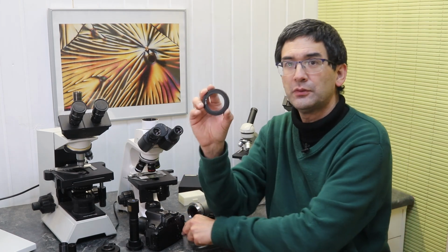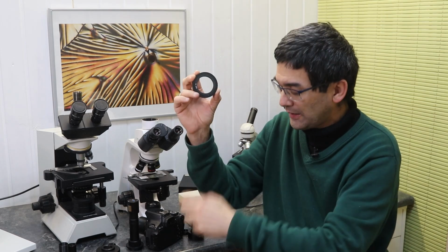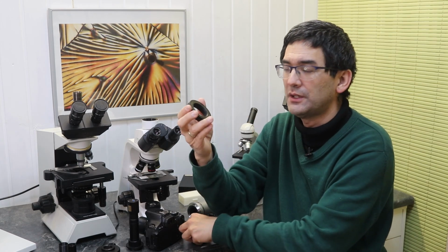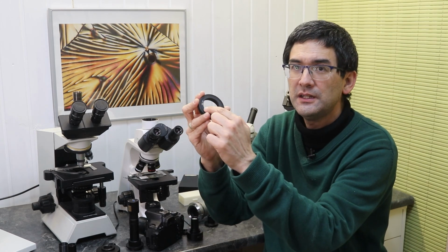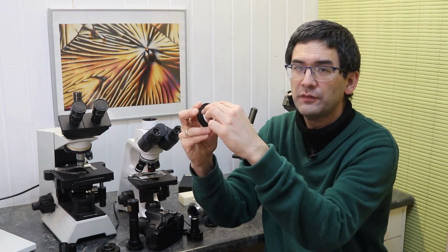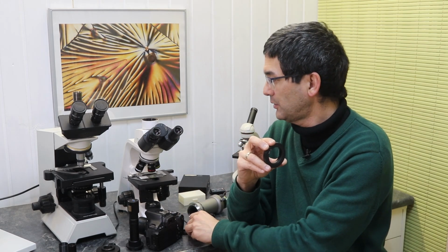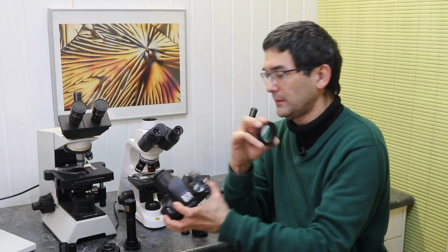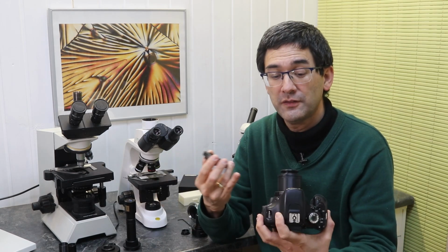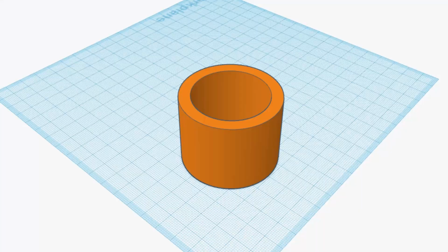The T2 adapter ring that I have here has another ring in here, which allows it to be connected to another adapter. What I've done is I've simply removed this inner ring, because there are some screws that allow you to remove it. And instead of this inner ring, I then connected the 3D printed tube. So this is basically all I've done. It was a fairly straightforward solution. I'm going to show you now how I've done that.